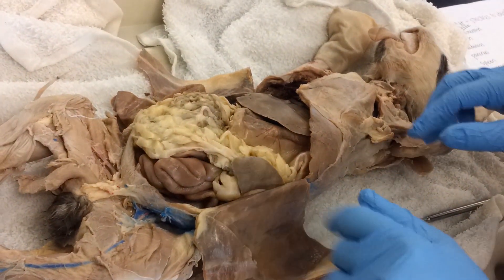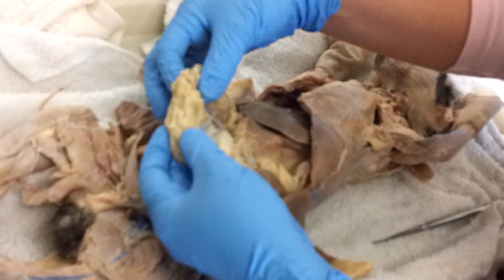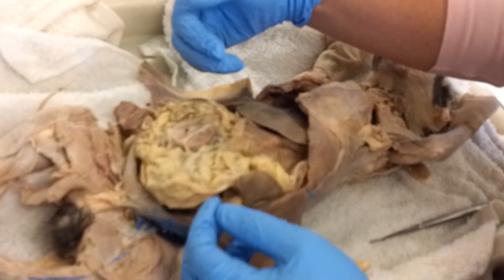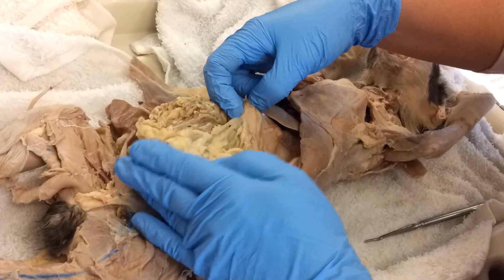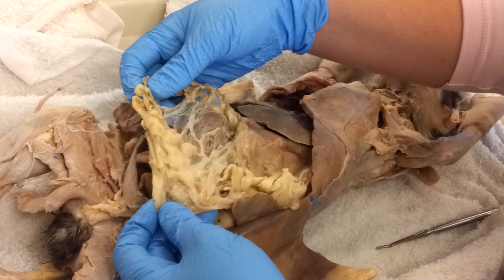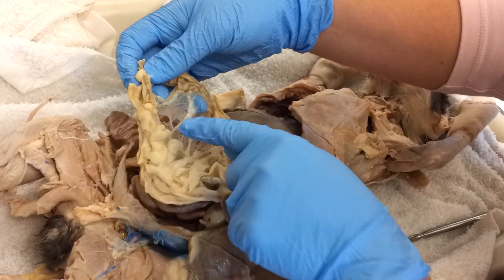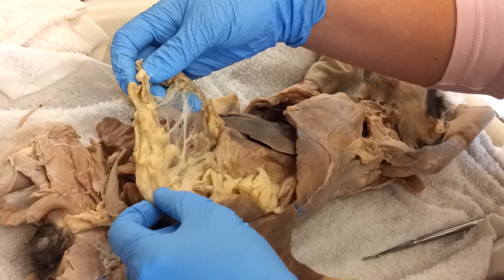Once you have the abdominal cavity opened up, the first structure that is pretty obvious to see is the greater omentum. This is a layer of mesentery that covers the intestines kind of like an apron. You can see it coming from the bottom of the stomach and then laying over the intestines. In fatter cats this will be filled with more and more fat. This cat is not very fat — see how thin the mesentery is right there. It kind of always has that honeycomb look though, with layers of fat throughout the mesentery.